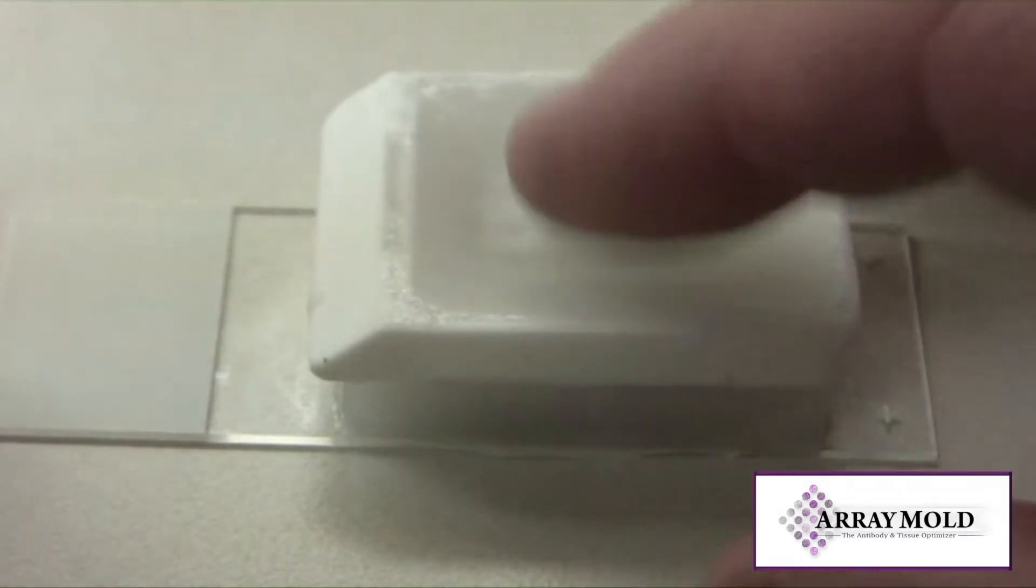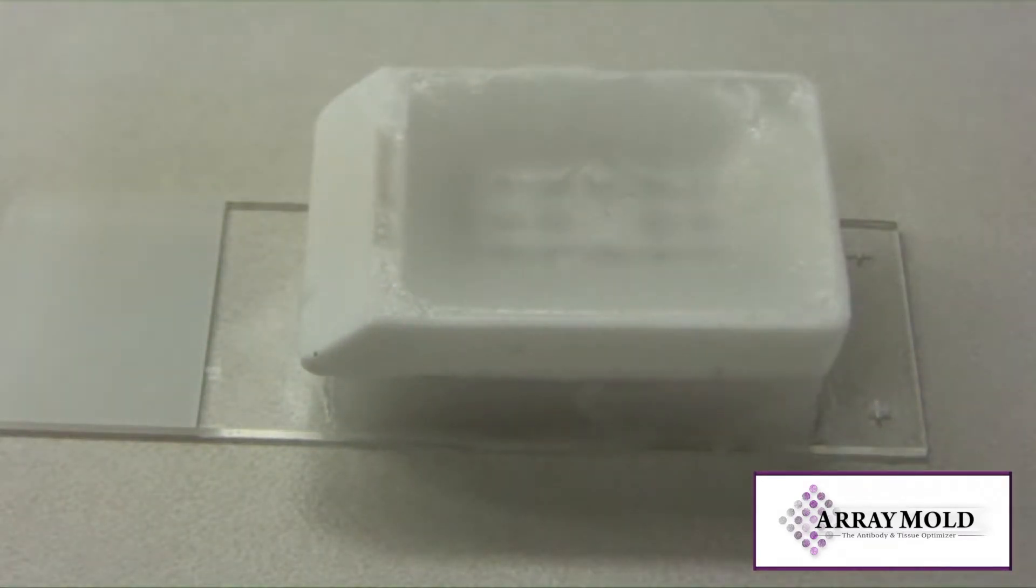Once liquefied, quickly remove the hot slide and flip the array block and the slide over on the countertop to cool at room temperature.